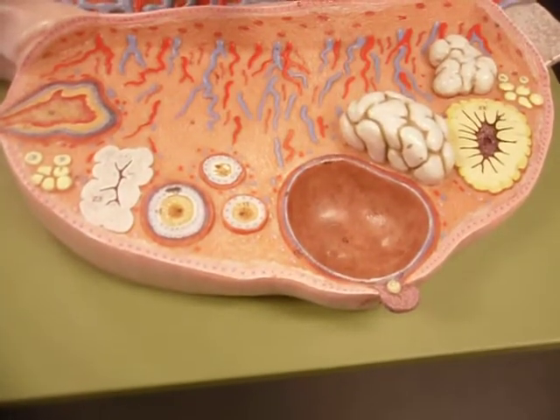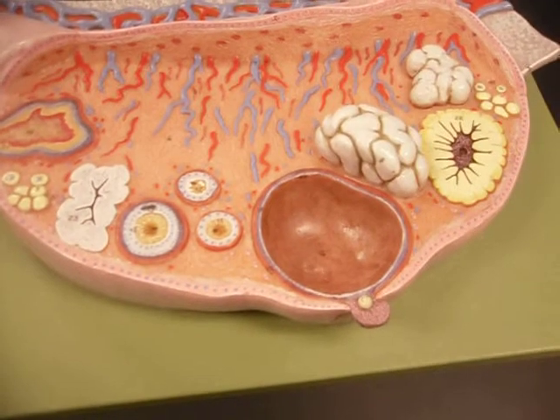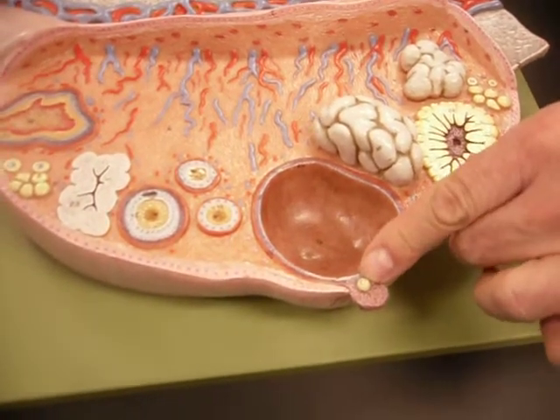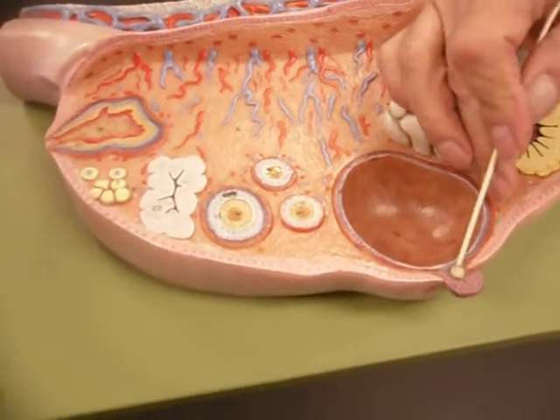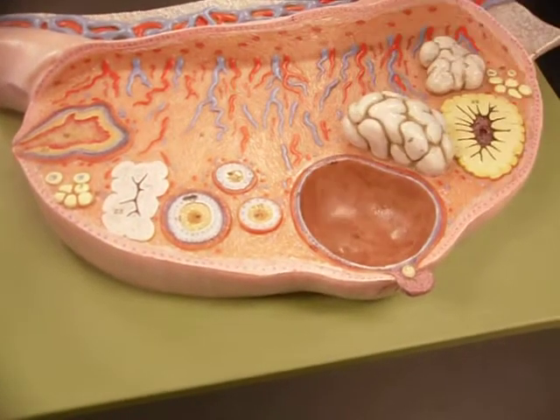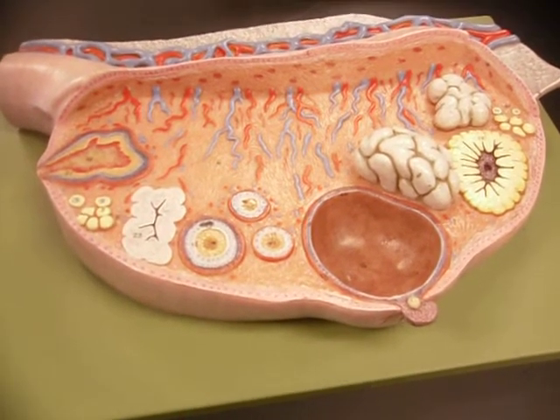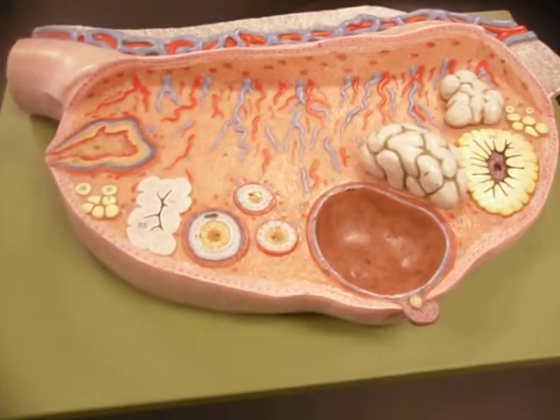Okay, like remember that secondary follicle you looked at way back in the lymph nodes? That dark area is the corona, surrounding what? The germinal center. Right. Okay. All right, so this is corona radiata. And here, now the egg is called a secondary oocyte. It's not mature yet. And it won't mature until it is fertilized. If it's not fertilized, it simply degenerates, passes through the uterine cavity, and is expelled with the menstrual flow, which is mostly much of the endometrium that goes. And since a lot of blood vessels break, that's why there's a lot of blood flow in the menstrual cycle.